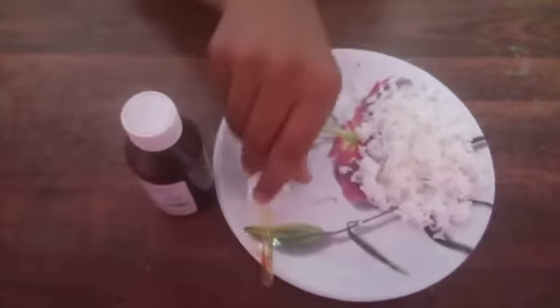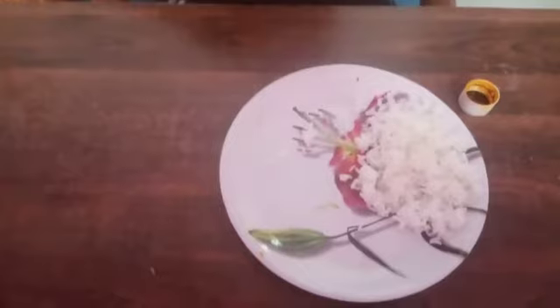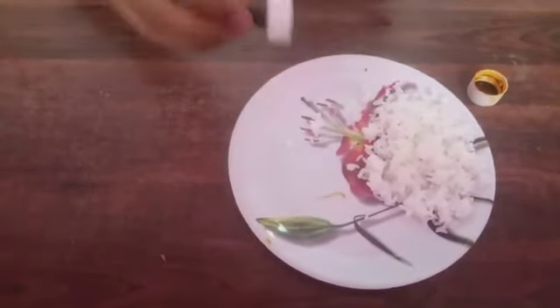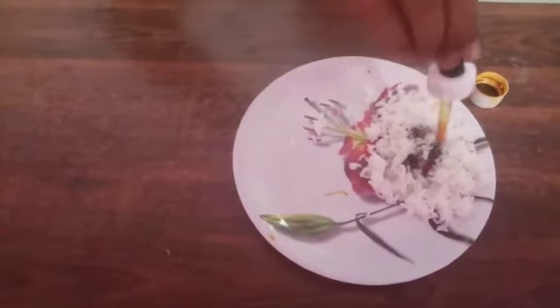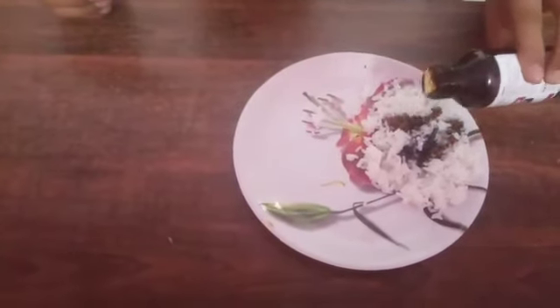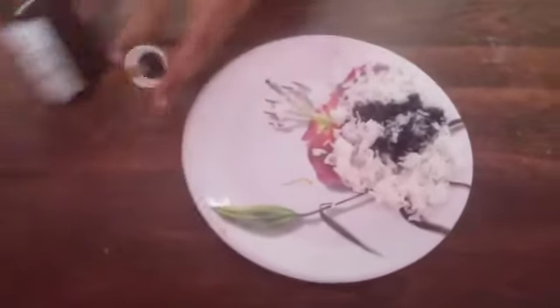First we have to take the dropper and put some iodine on the rice. Here you can see the blue-black color change of the starch. This confirms the presence of starch in the food sample.